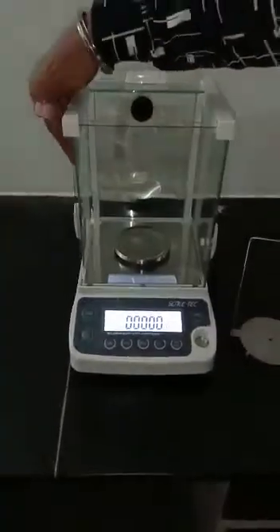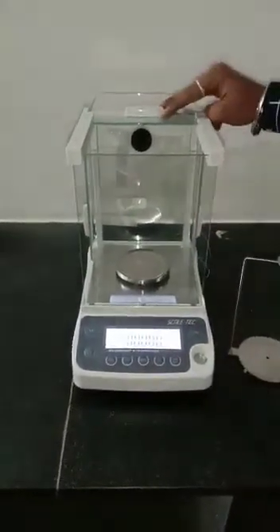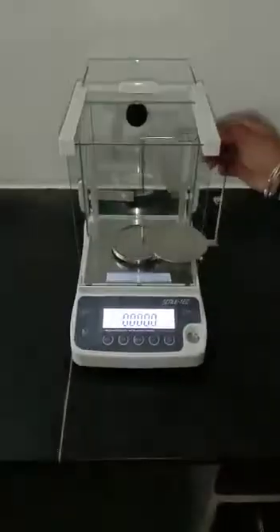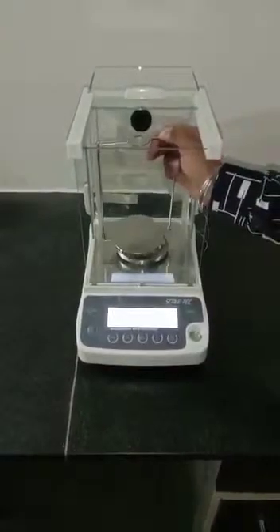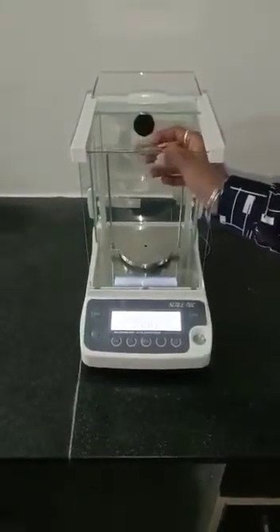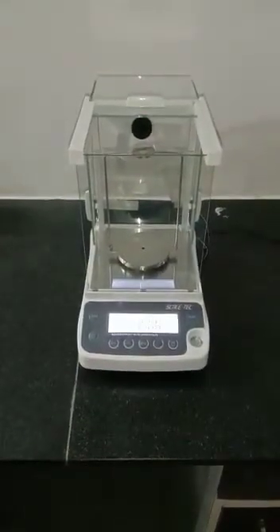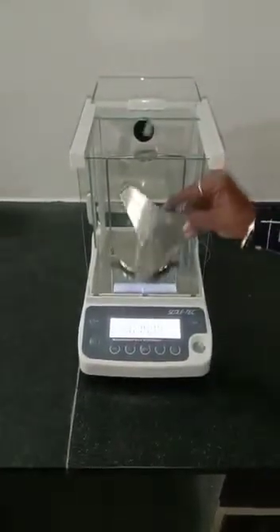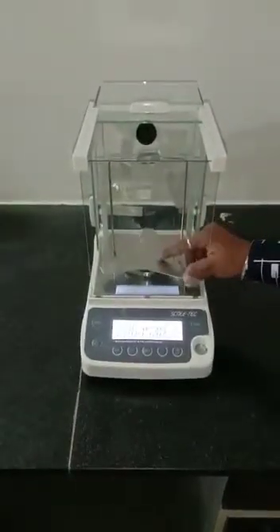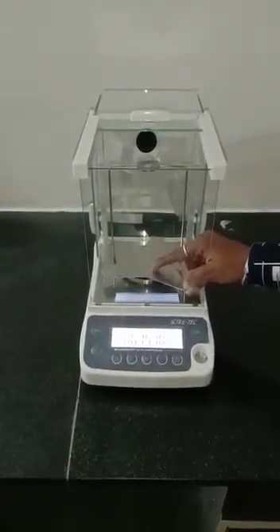First of all, open all the doors of the balance. Put the weighing assembly inside the balance on the weighing pan. After that, put the tripod stand in place and make sure that the tripod stand does not touch the weighing pan or weighing assembly.